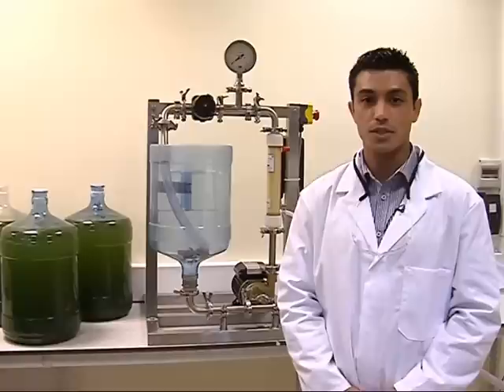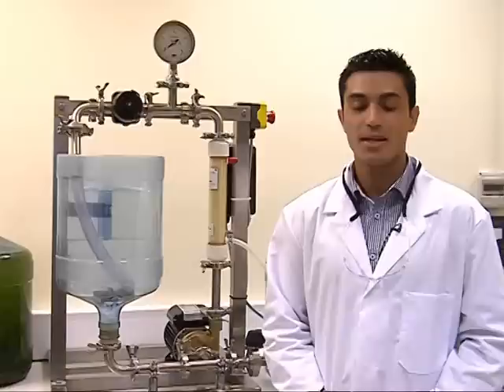Hello, my name is Michael Gerardo. We are here in Swansea University to demonstrate how cross-flow membrane filtration works. Let's look at a brief list of possible applications of cross-flow microfiltration.